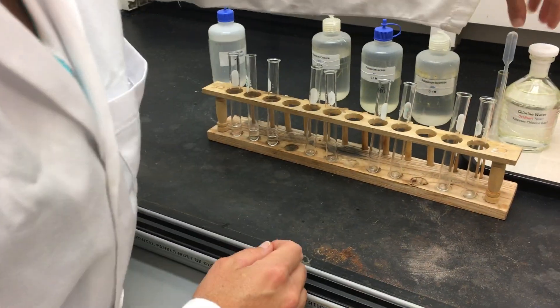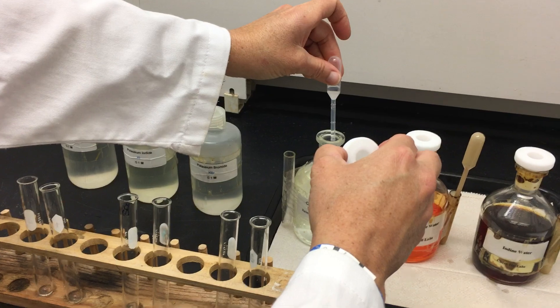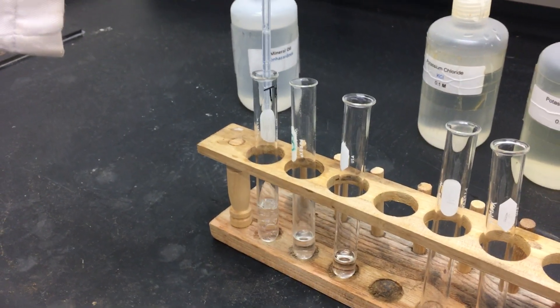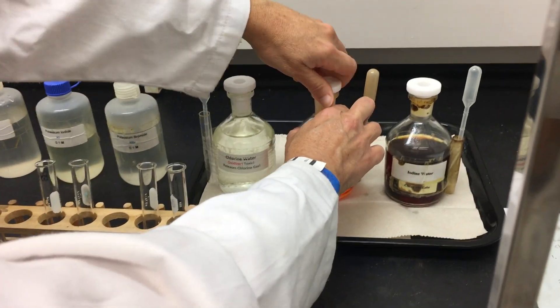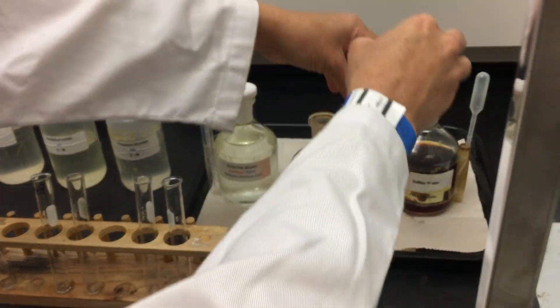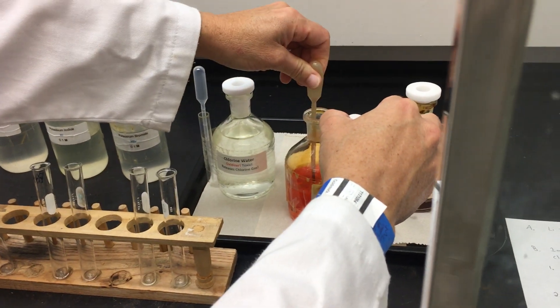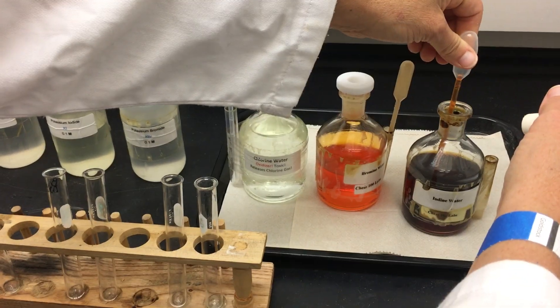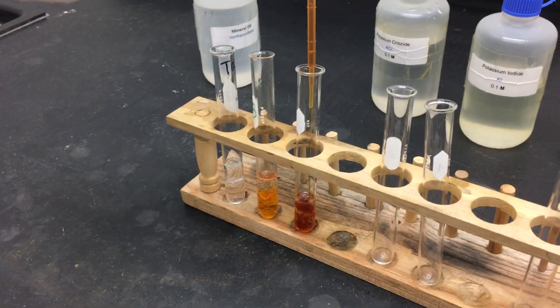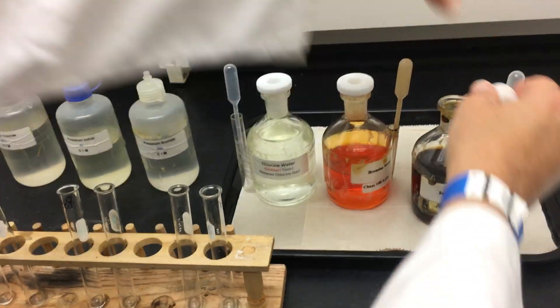To the first test tube we're going to add about one milliliter of the chlorine water. Now to the second test tube, I'm going to add about one milliliter of the bromine water. And then to the last test tube, we're going to add one milliliter of the iodine water.